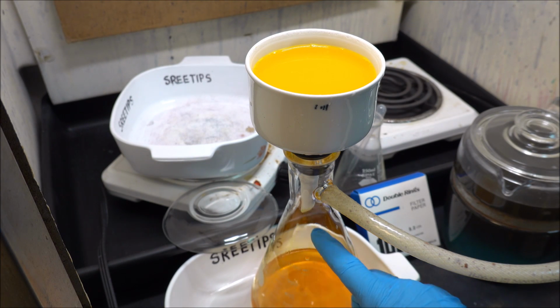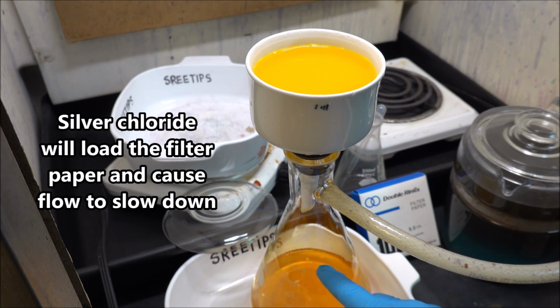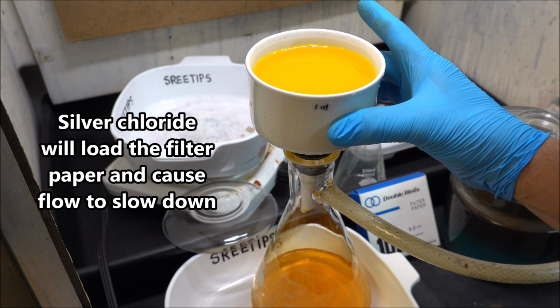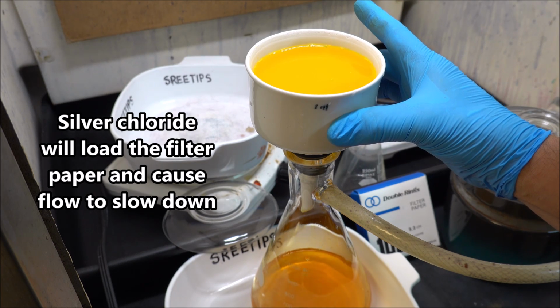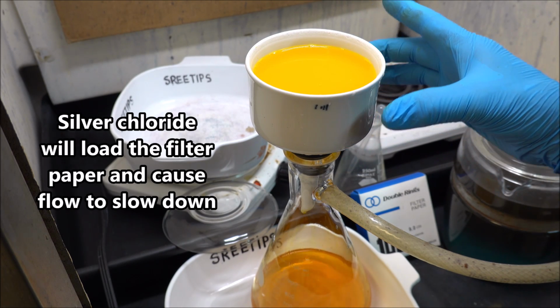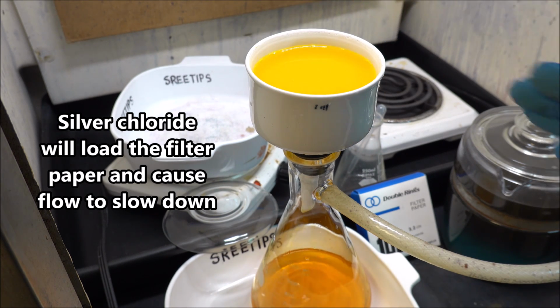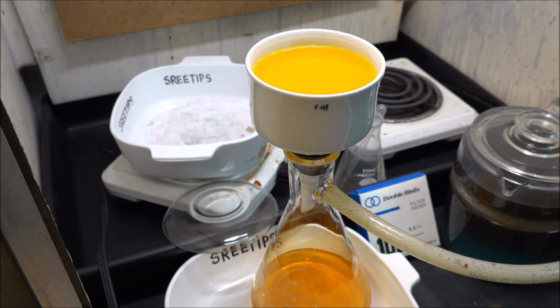It's slowed down now to just drips. It's coming through there pretty good, but I've got a whole funnel full of solution that has to be pulled through that filter paper and the other solids that have accumulated to load the filter paper up. It's going to take a while, and this is another disadvantage of having a bunch of silver chloride in with the gold. It slows the filtering process way down.